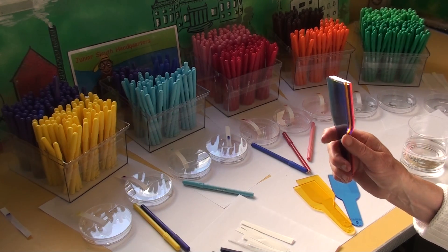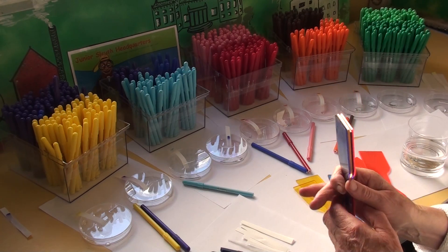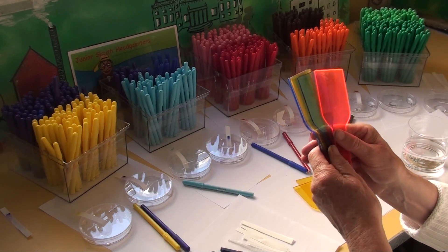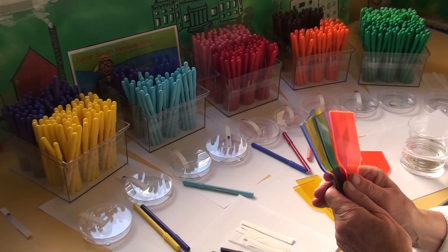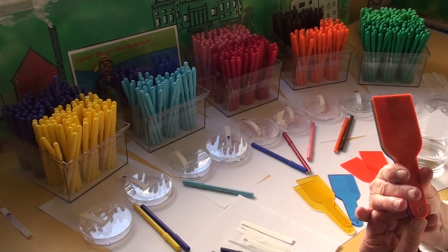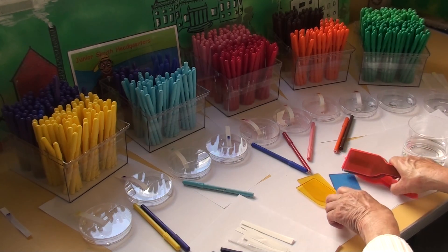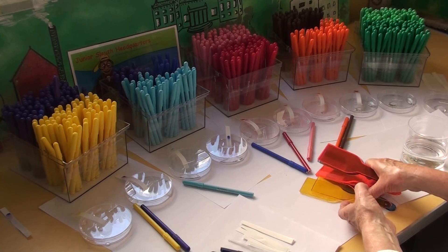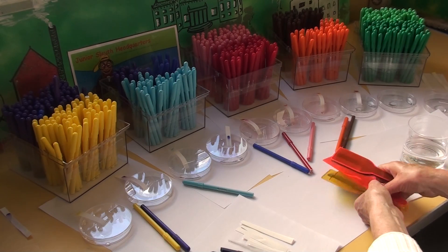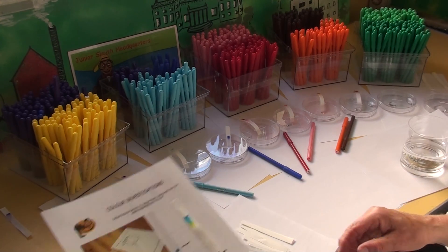That's what you use when you're colouring in and painting. But if you're doing science, you can also separate colours. Scientists can solve problems by doing this — I'll show you an experiment about separating colours and solving a problem.